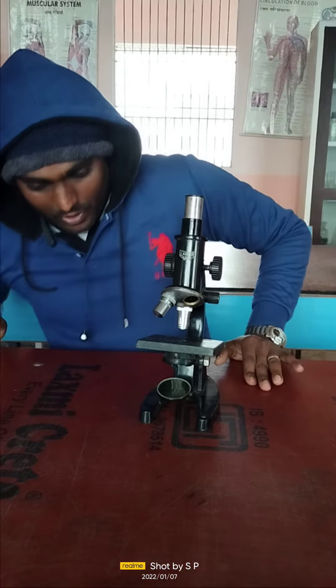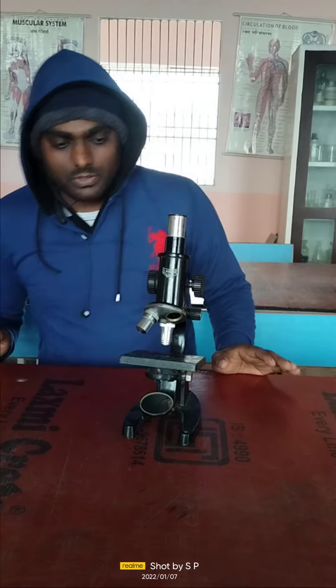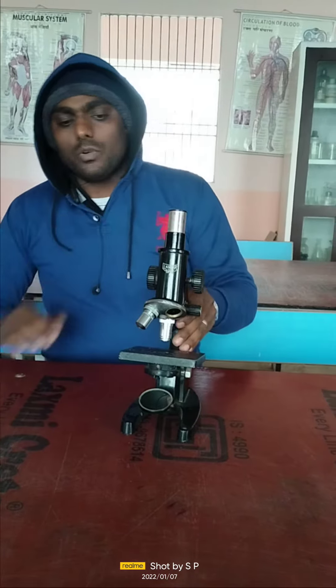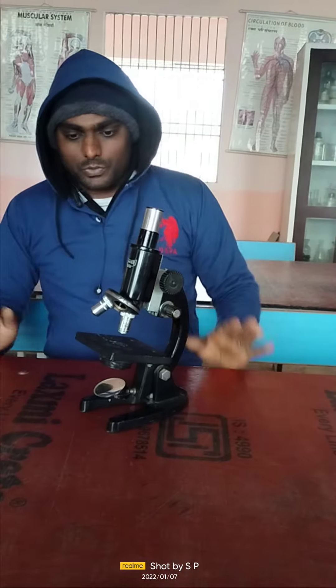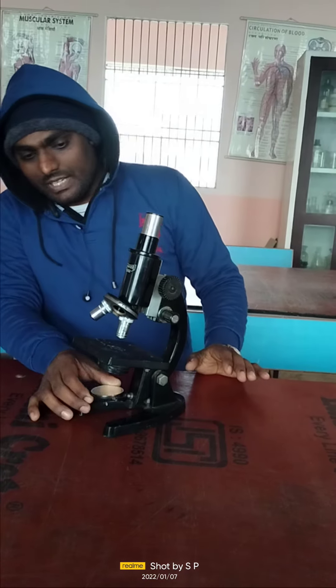Today I am going to explain how we can use a compound microscope, how it works, and how we can use it to observe different specimens. This is a compound microscope in which a concave mirror is used to focus the light on the lens.